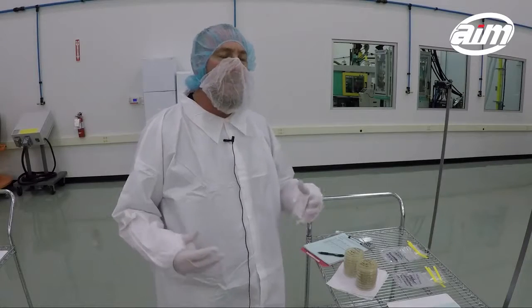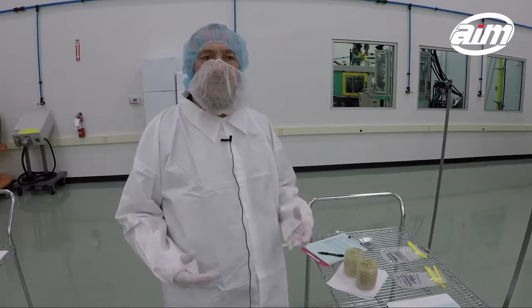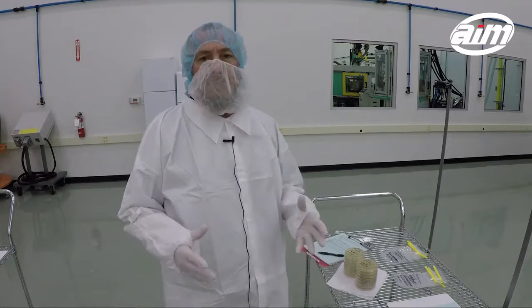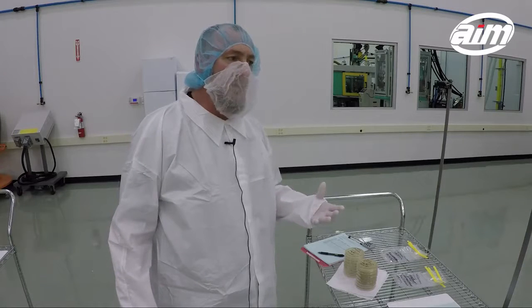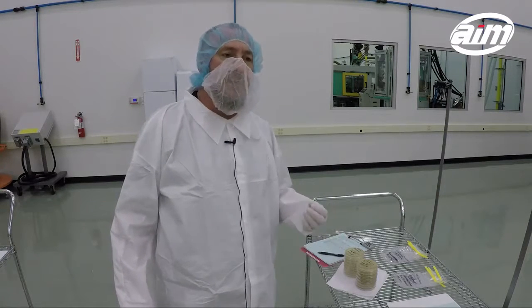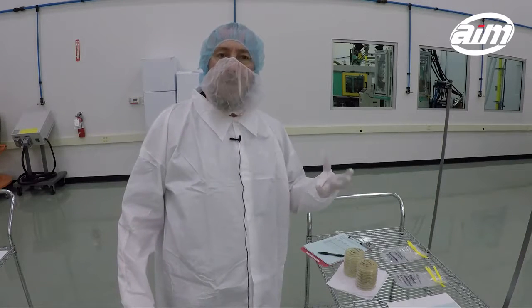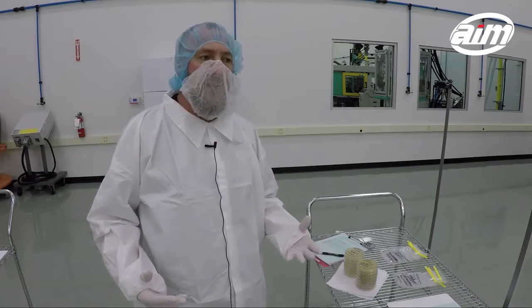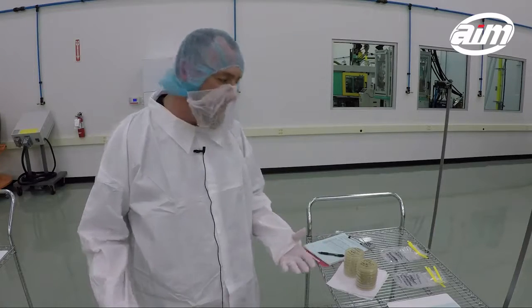We're looking for potential microorganisms in our clean room. We're going to do two types of sampling today: a viable sampling for bacterial matter, and a viable sampling for fungal mold spores. So we're doing two types of collection of samples for different types of organisms in our clean room.